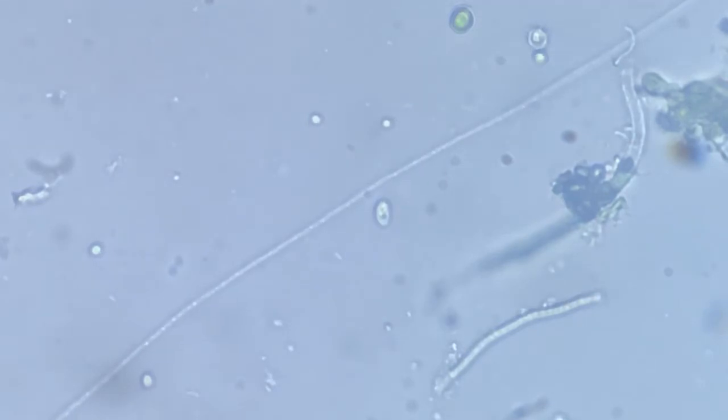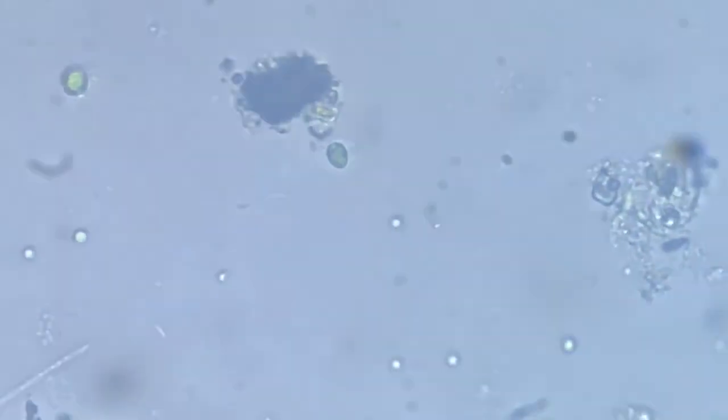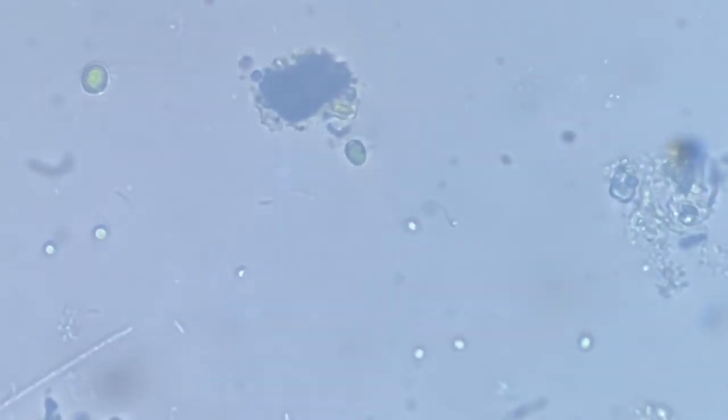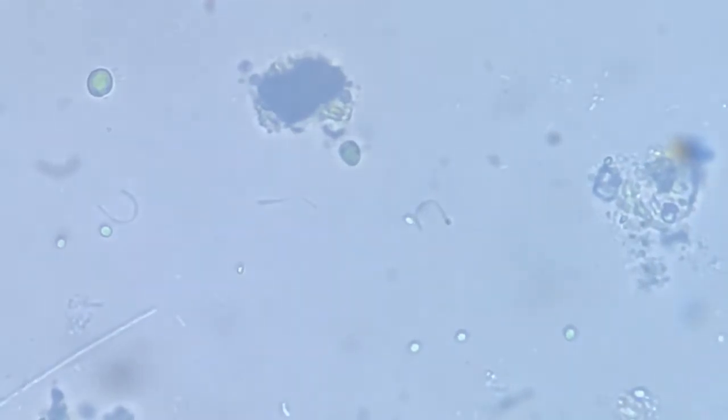It's not still. Just to bring it back in perspective, let me get to the head portion, the tip, the anterior head, so that you can appreciate the movement. Okay, from here, I presume, since they generally follow a straight line, it will be going diagonally up towards 1 o'clock direction, and we can make out the kind of body streams that they have.